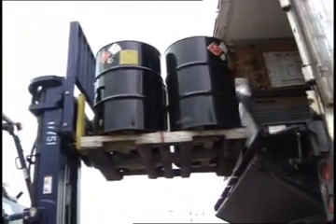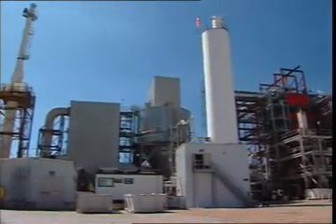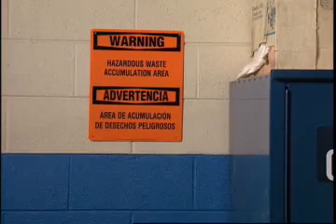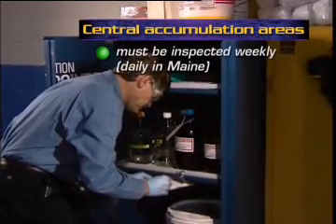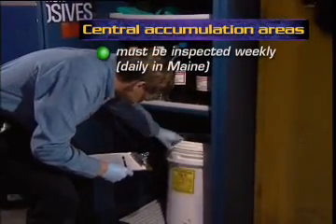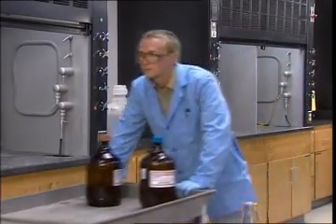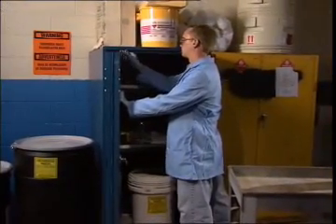When wastes leave the lab, they may be shipped directly to a specially permitted off-site facility for recycling, treatment, storage, or disposal. Or, more commonly, they may be sent to a central on-site accumulation area. Central accumulation is normally under the supervision of environmental specialists who manage the accumulation, lab packing of smaller containers into larger containers, and shipping to a permitted off-site facility. In the central accumulation area, wastes will be held, along with wastes from other on-site labs or other generating areas of your operation, for later shipment to an off-site treatment facility.